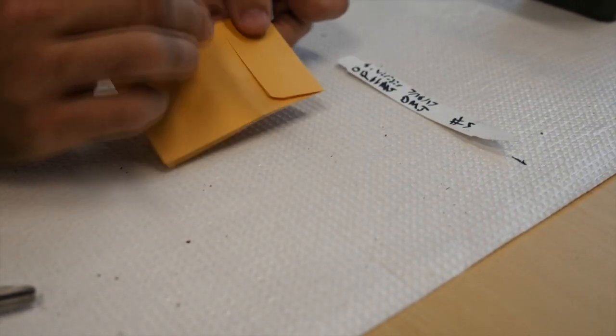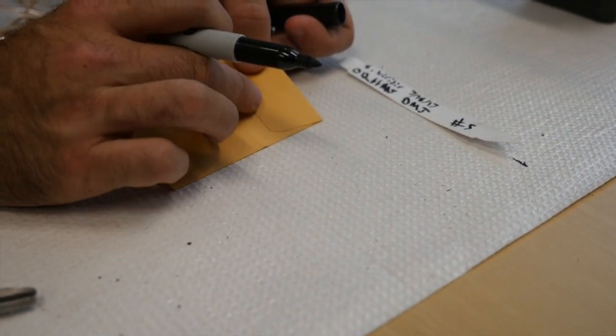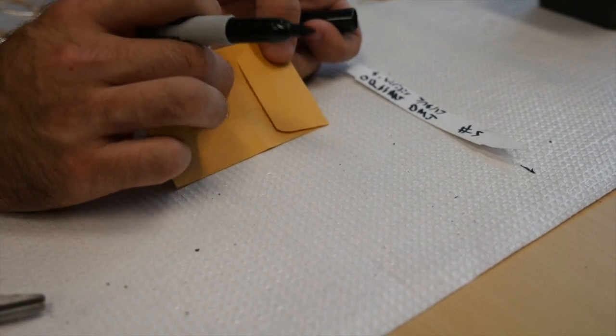And if you need to, you can take a little piece of tape, put it across here, and then store these at room temperature.